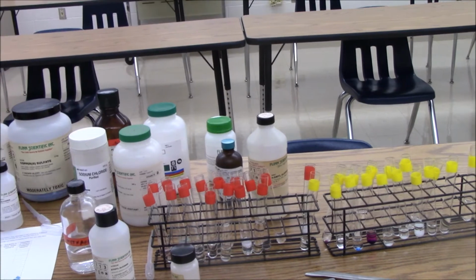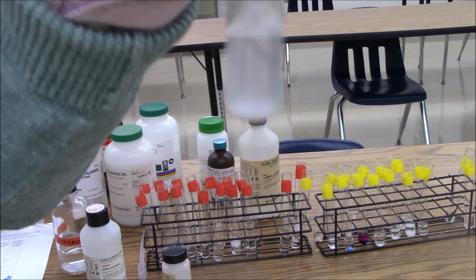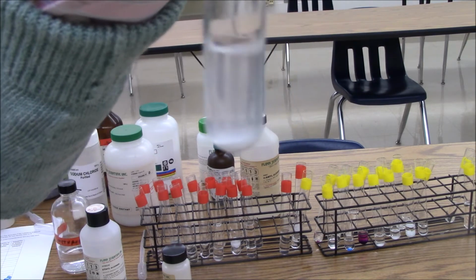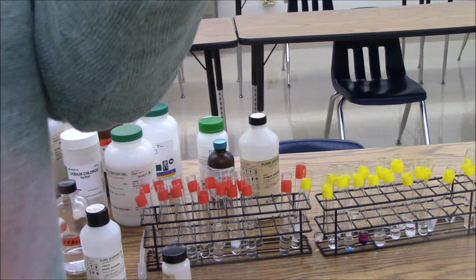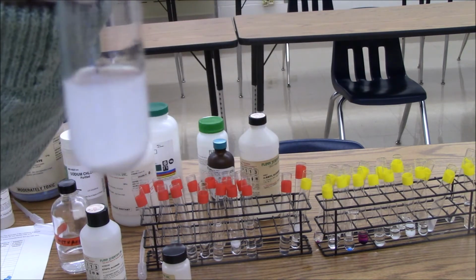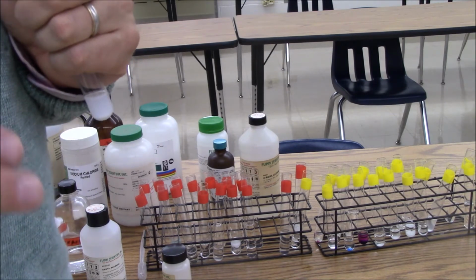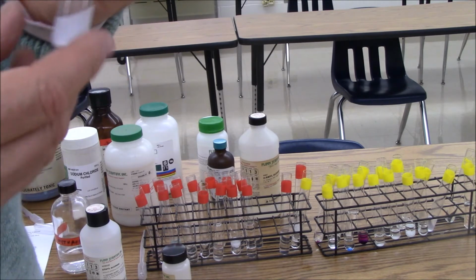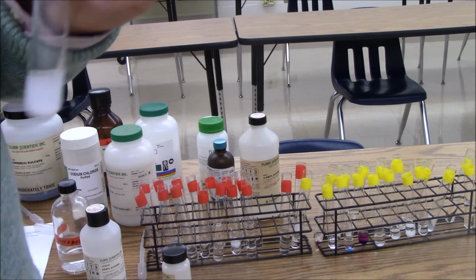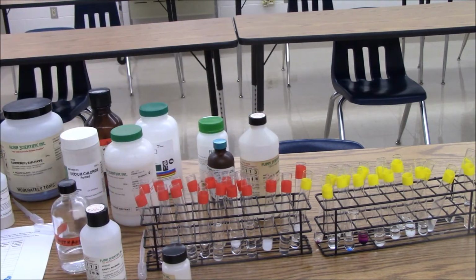And we're down to one more chemical. The last chemical we're going to do is calcium phosphate. This is an ionic chemical, so we're not surprised that it's insoluble in the nonpolar hexane. However, it's also insoluble in water. We'll go over this a little bit in more detail, but essentially the ionic attractions, the ionic bonds, are so strong that this chemical won't dissolve in either polar or nonpolar liquids. So while the like dissolves like rule is pretty good, it worked for the vast majority of these, it's not perfect.